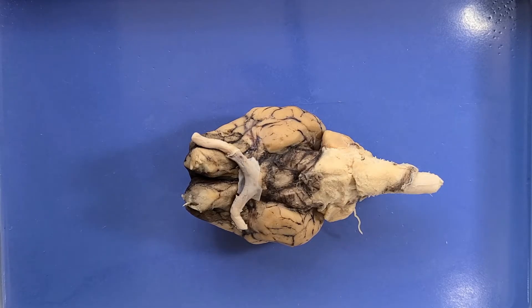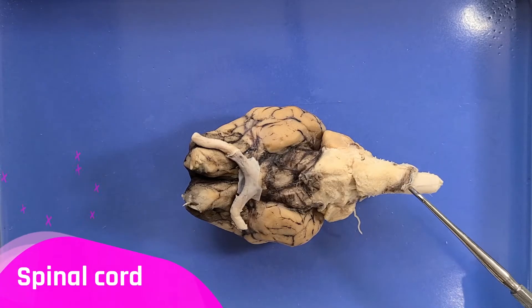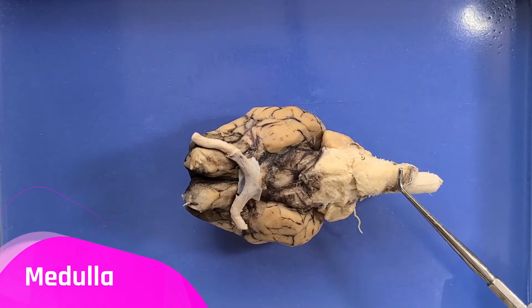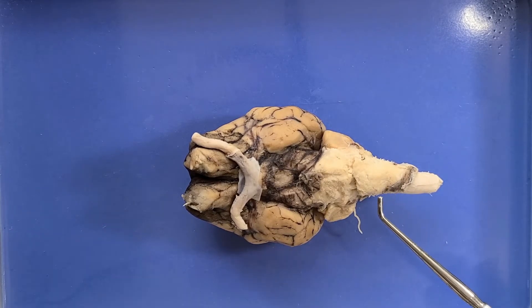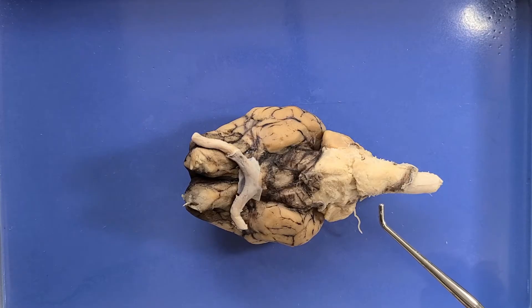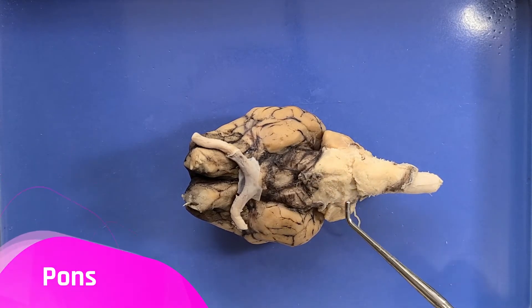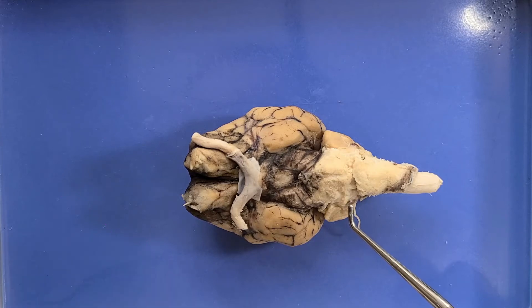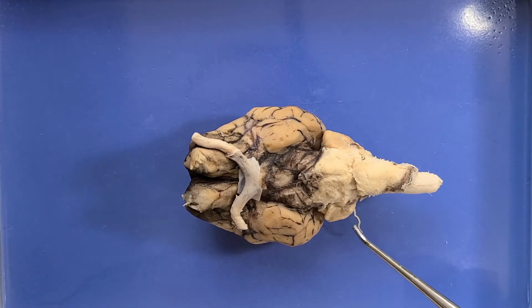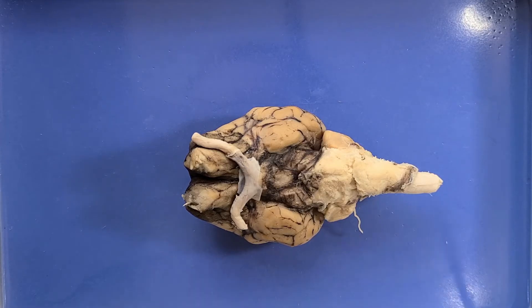All information relayed from the brain to the body and vice versa must travel through the brain stem. There are a few different parts of the brain stem. First is the spinal cord. Then this first bump is the medulla, which controls various autonomic involuntary functions like digestion and heart rate. The second bump is the pons, which regulates vital functions such as breathing and sleeping. The next part, the midbrain, is located further in.